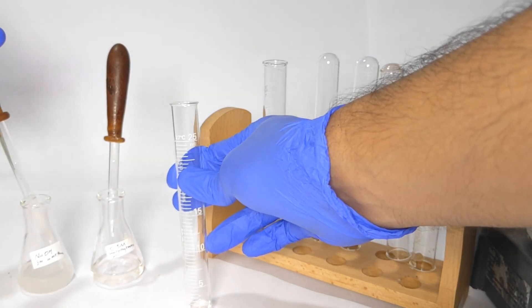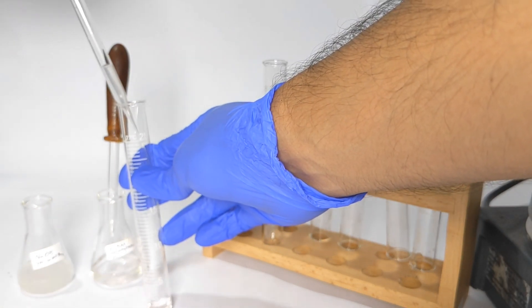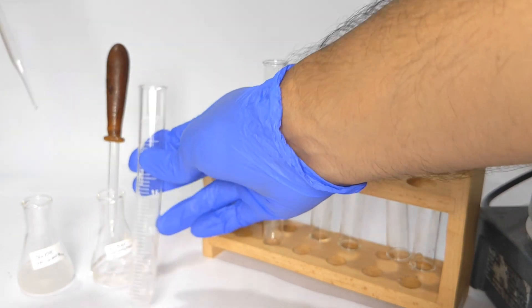Then we add approximately 2 milliliters of 3 molar sodium hydroxide solution in methanol. This will freebase the hydroxylamine.